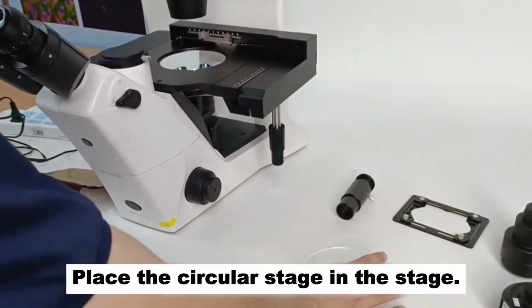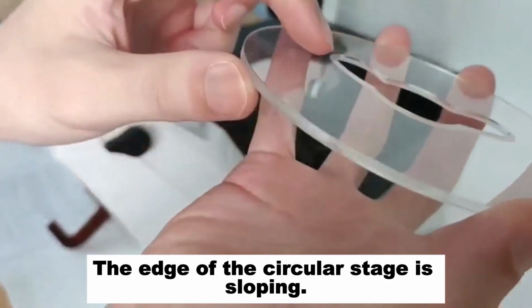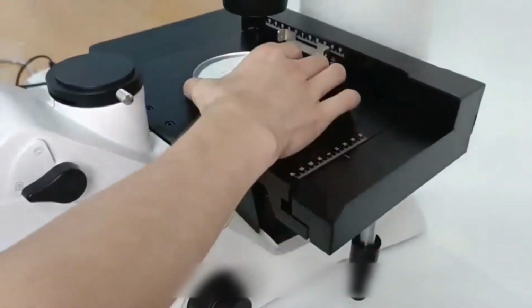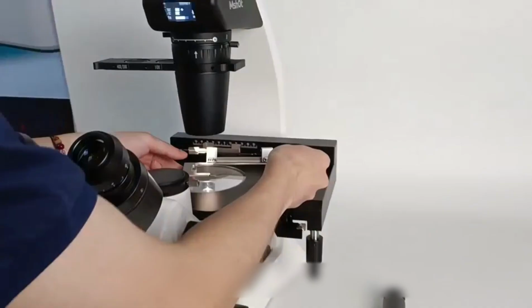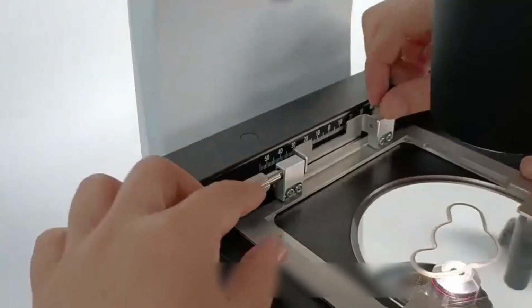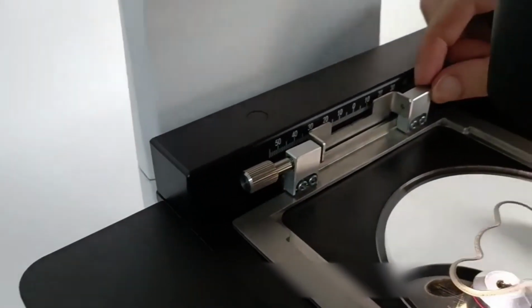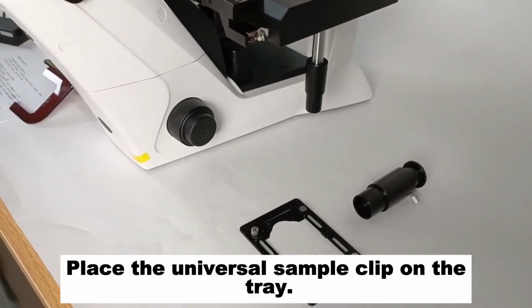Place the circular stage in the stage. The edge of the circular stage is sloping. Place it as shown in the figure. Place the universal sample clip on the tray.